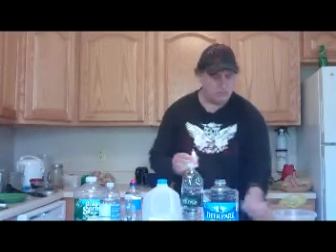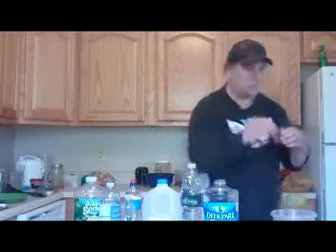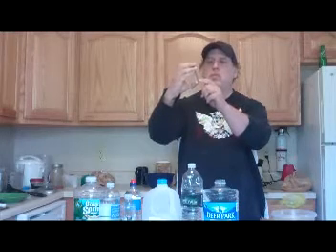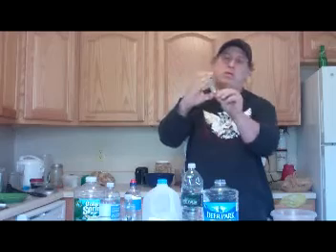We add about 5 droplets. I don't know if you can see the colors on the camera, but this is like an orange. And orange is acidic. The scale right here, which indicates the color, shows that Deer Park is not good. Put this to the side. Bad news, man. Don't buy Deer Park water.